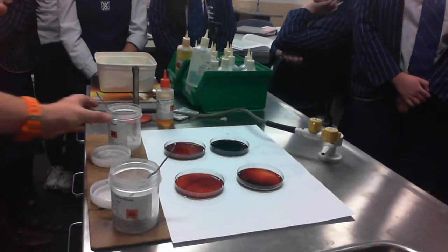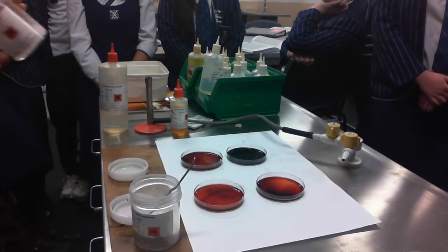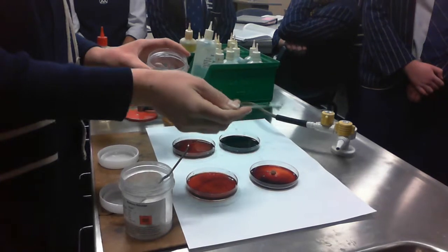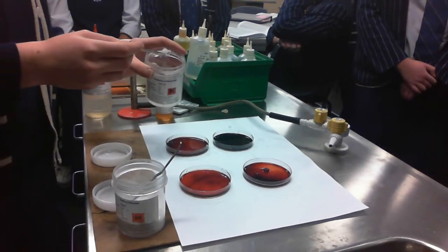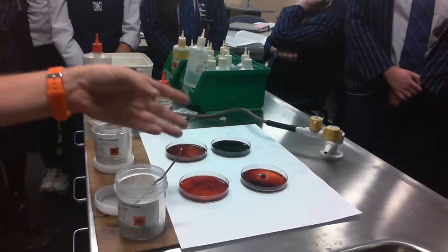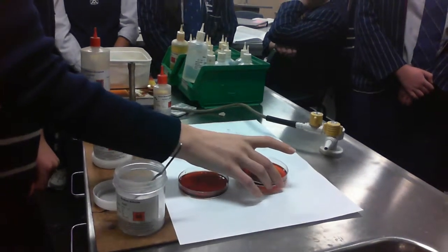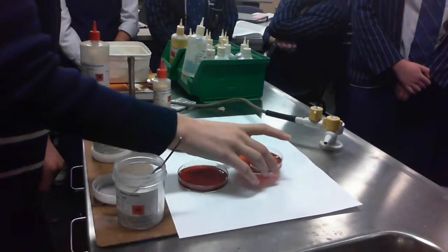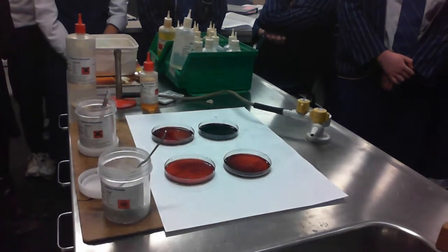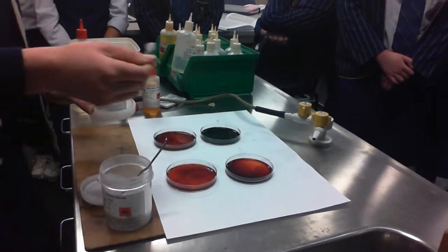Add potassium thiocyanate powder. Okay, so you can choose any one of those apart from the one you've used and the one nearest you from it. That much? If you like. I'll just say much. That's a good amount. Okay, so it takes a while to dissolve, and where it's dissolving it goes quite clear. That's because of the thiocyanate, which has no colour. But if we swirl it, we can see compared to our control, it's getting a bit darker, maybe a little bit more, just because it hasn't all dissolved yet.